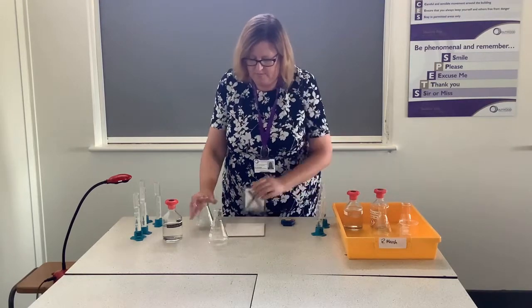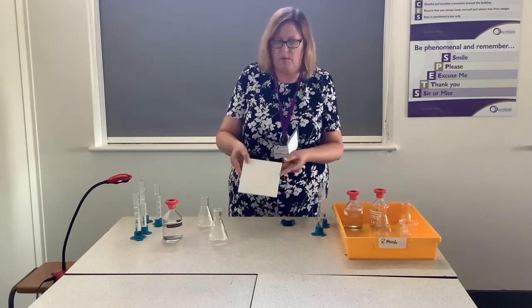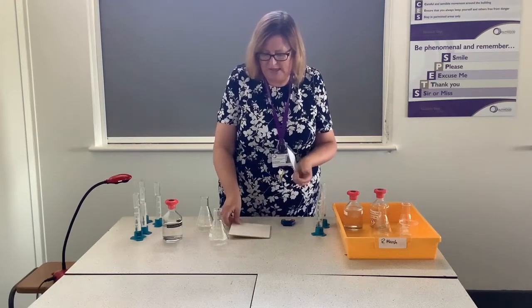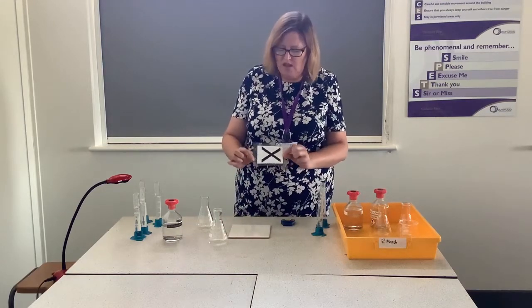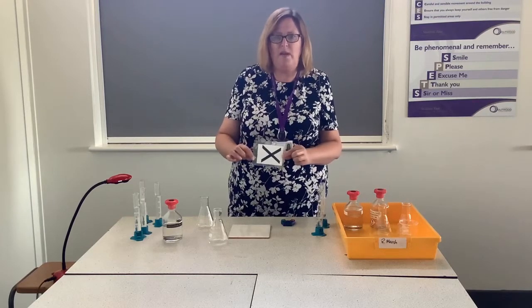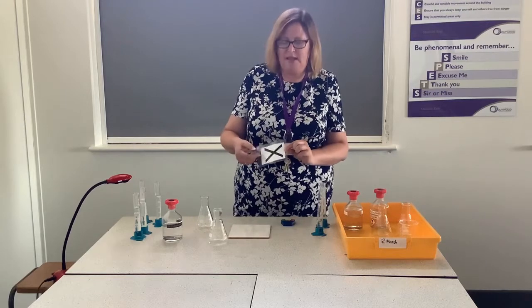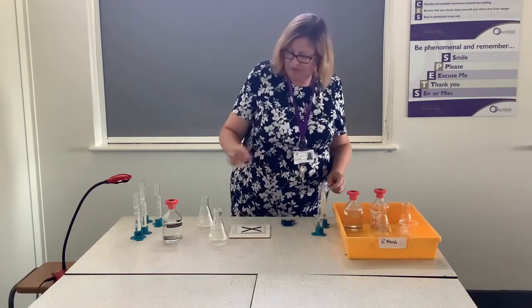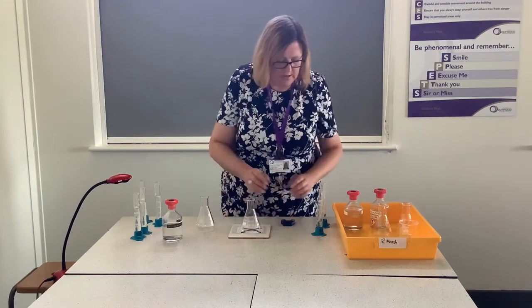We need a white tile in order to allow us to be able to see any colour changes more easily. We've got a pre-printed cross. When you're doing this, it's important that you use the same cross for all of your experiments so that you are not putting an extra variable in there that might change how quickly it appears that the cross has disappeared. We're going to use a conical flask which we stand clearly over the cross.